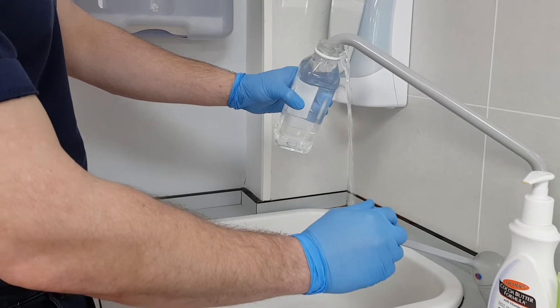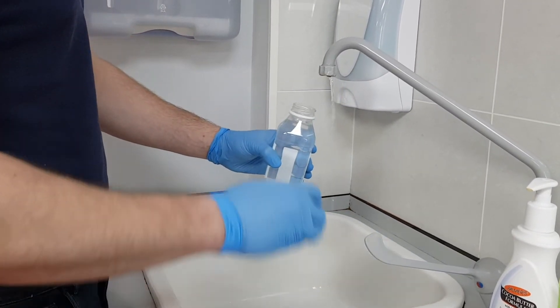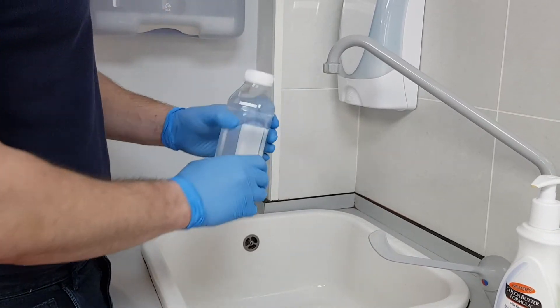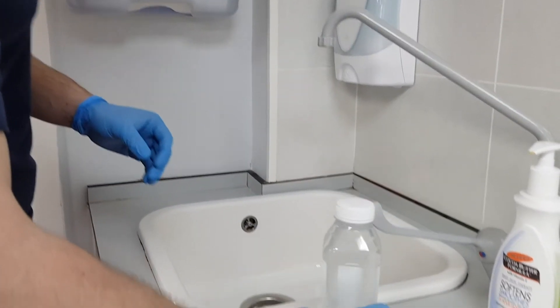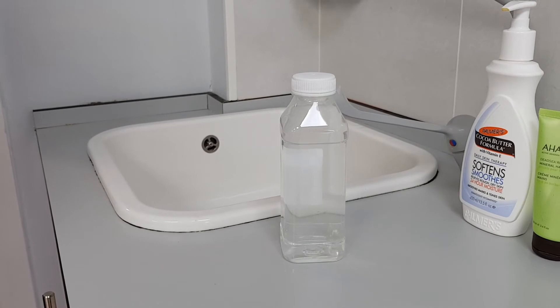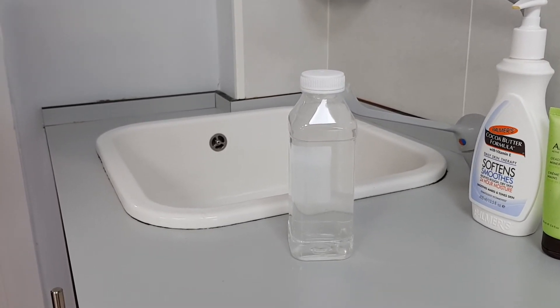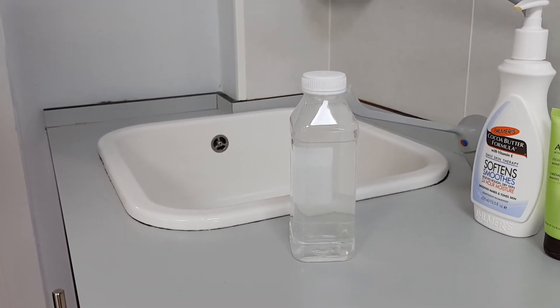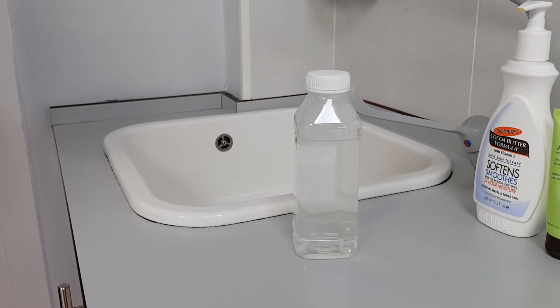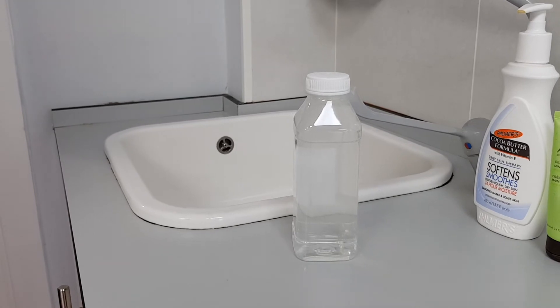You should also cool if necessary as high temperatures interfere with the test. To cool, fill a clean sample bottle to the brim, cap it securely, and then run cold water over the outer surface for a minute or two. Filling to the brim and capping the sample will prevent the loss of chlorine dioxide to atmosphere before testing. Sample bottles used for this test should not be treated with thiosulfate as this will neutralise any oxidants present.